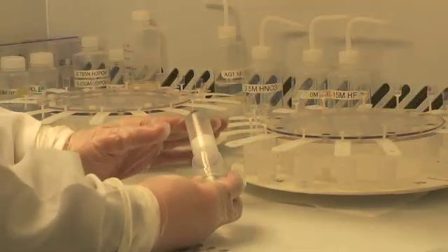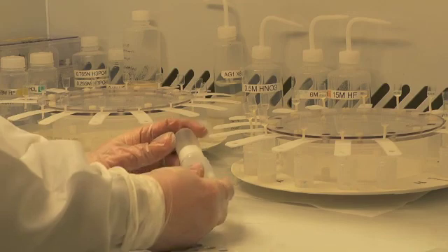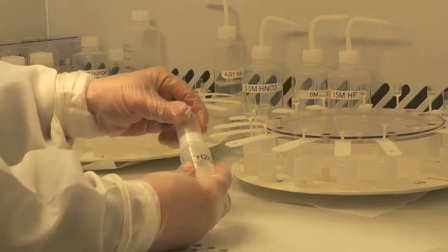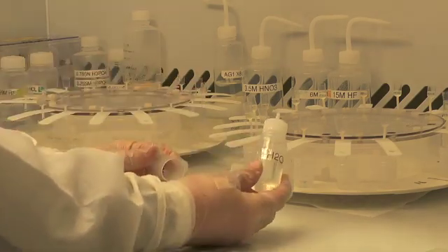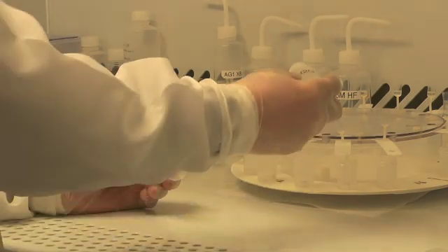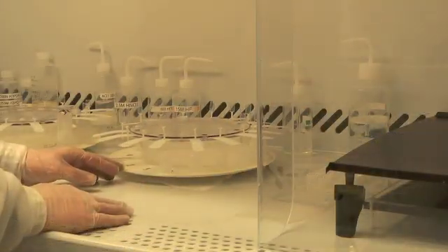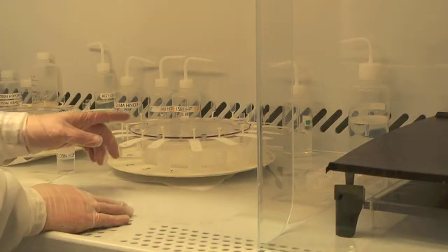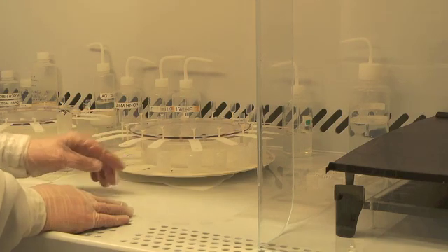Now that we've stripped the lead from the columns, we need to elute the uranium. We elute uranium off of anion exchange resin using clean water.